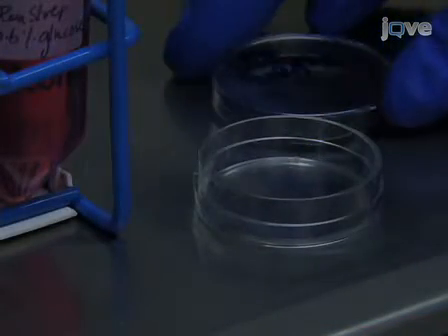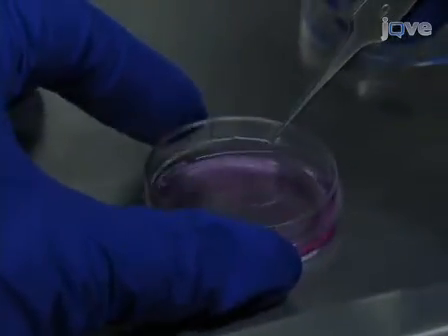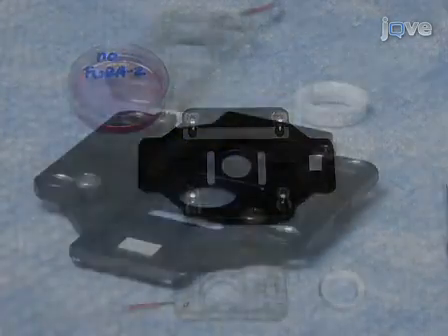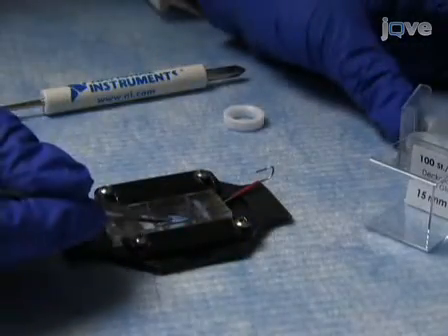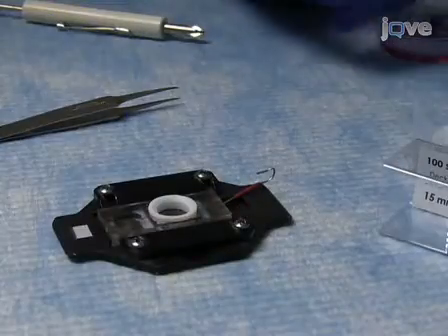During the incubation, prepare another 35mm tissue culture dish containing 2 milliliters of tissue culture media without Fura-2-AM. When the incubation is complete, remove the coverslip from the loading solution and place it in the new dish. After immersing the coverslip in Fura-2-AM free media, mount it onto an imaging chamber. We use the RC-20H imaging chamber by Warner Instruments. Apply vacuum grease to both sides of the chamber, place the coverslip onto the chamber, press it into position, screw in the side clamps, and insert the coverslip retainer ring.